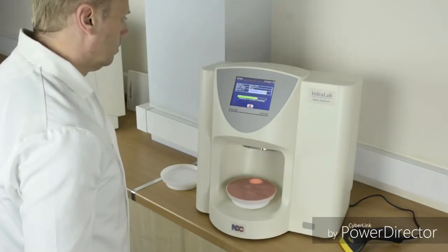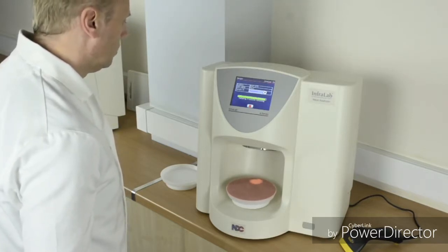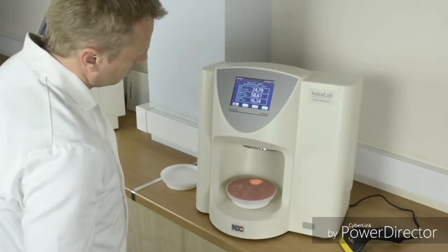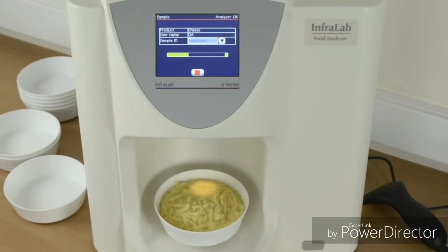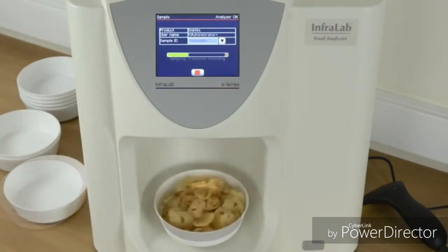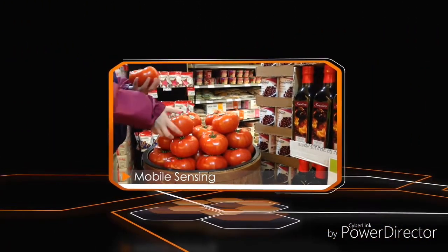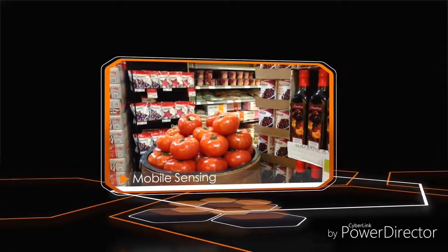Infralab can measure almost any powder, flake, or granule, and for the majority of products, no special sample preparation is required. Infralab can easily measure products such as cheese, coffee, snacks, tortilla and potato chips. Use mobile sensing to measure produce quality and ripeness, from crop harvesting all the way to store shelves.